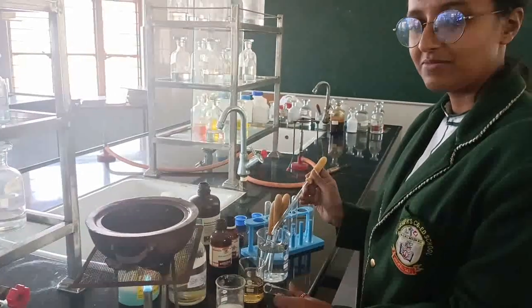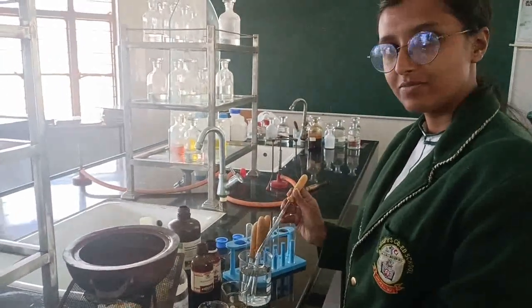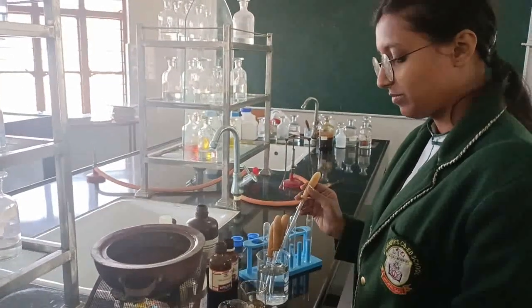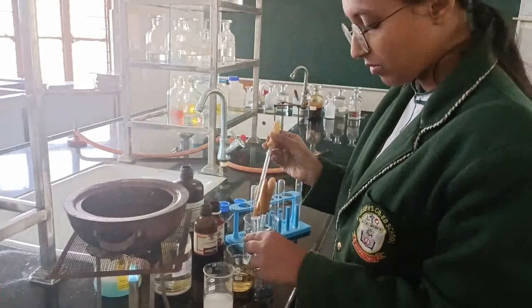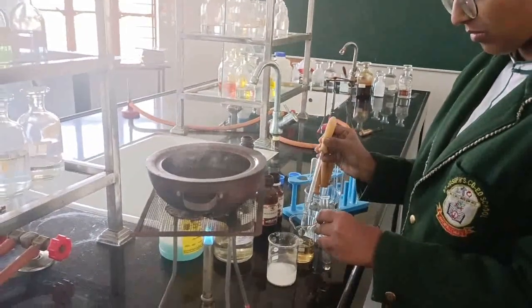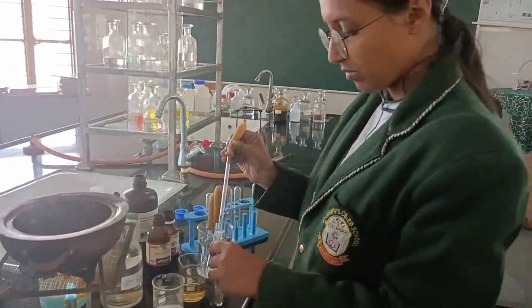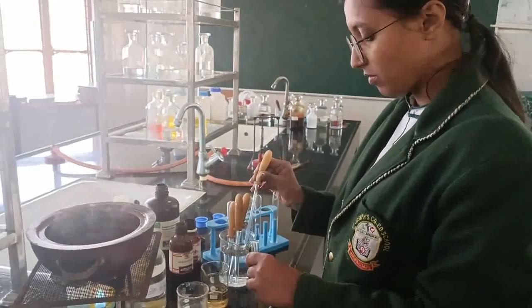Which test are you going to perform for carbohydrate? Molisch test. Okay. So take a sample in the test tube. The given sample you will have to take in the test tube. We have kept the water bath ready because in some of the tests the heating will be required through the water bath. So have you taken?